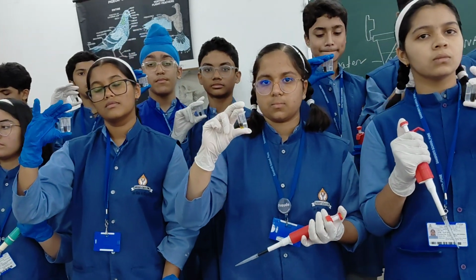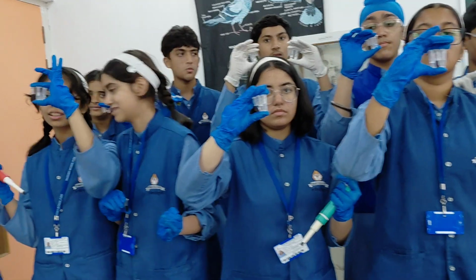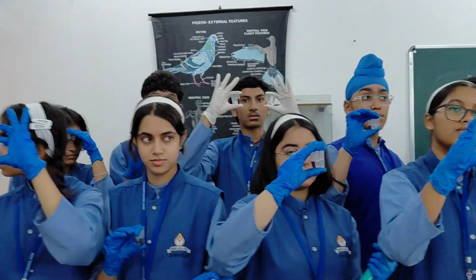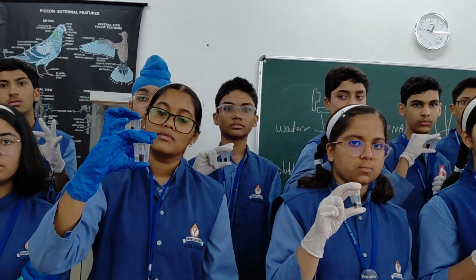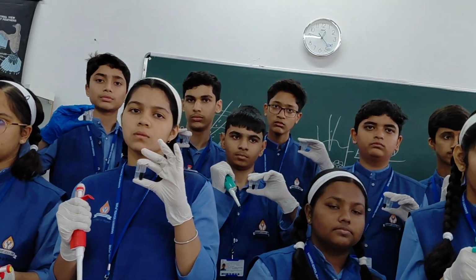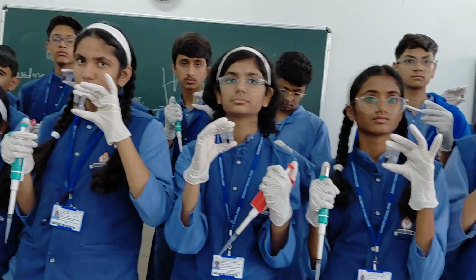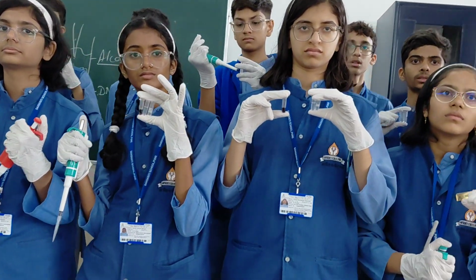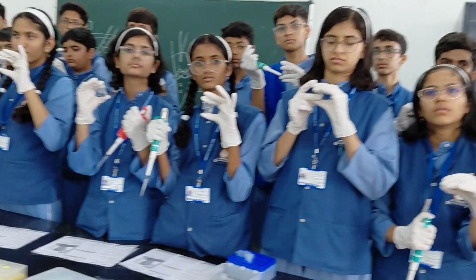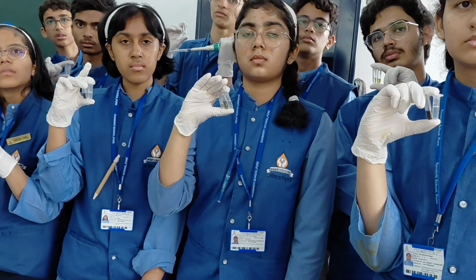It precipitates the DNA and you can see the DNA clearly visible in your tube in the form of glassy, thread-like structures, right? After the alcohol, if we centrifuge the tube, then your DNA will stick at the bottom. Open the cap and remove all the liquid into the basin. Only the DNA will be left in the tube. Because it is in alcohol, keep the mouth open, the alcohol evaporates, the DNA dries. Once the DNA is dry, it is ready for the elution and storage process.